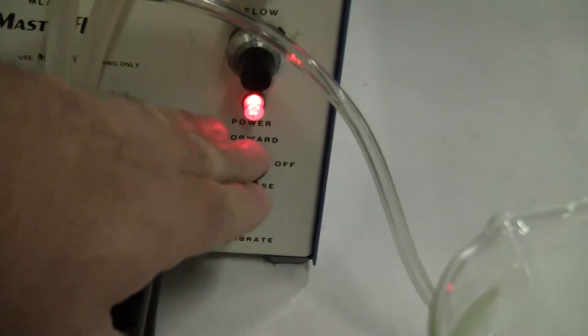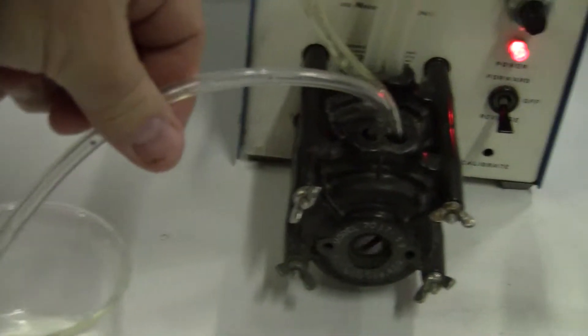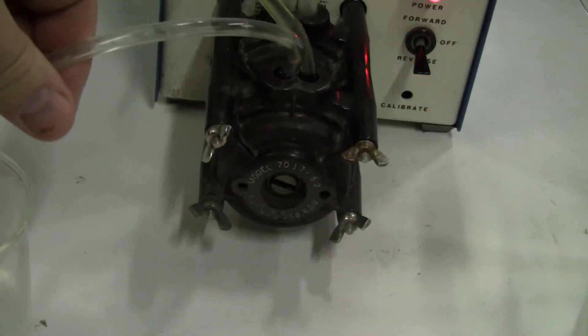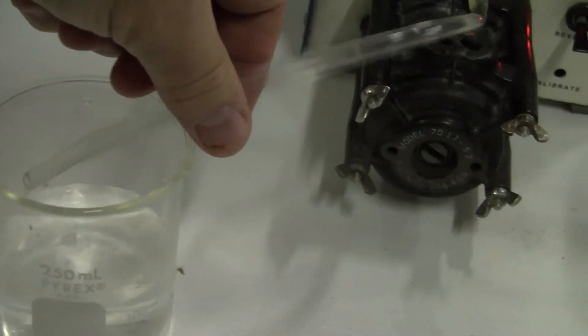And then you can also reverse it. See if you have enough in there. Reverse. There we go, reverse.